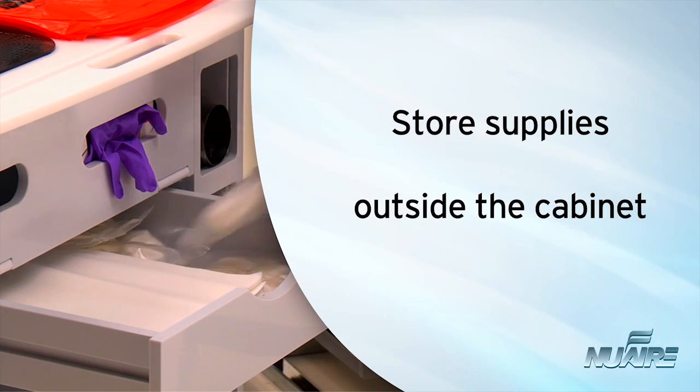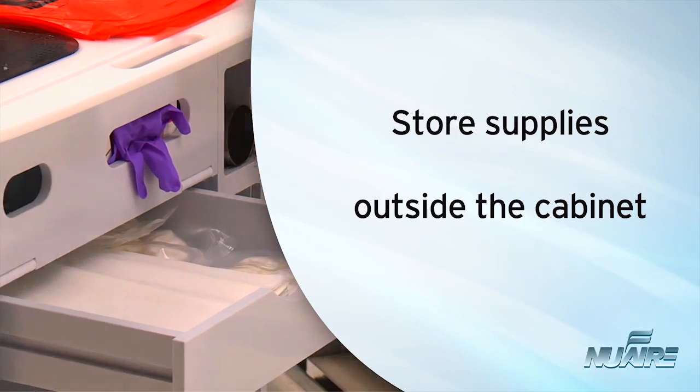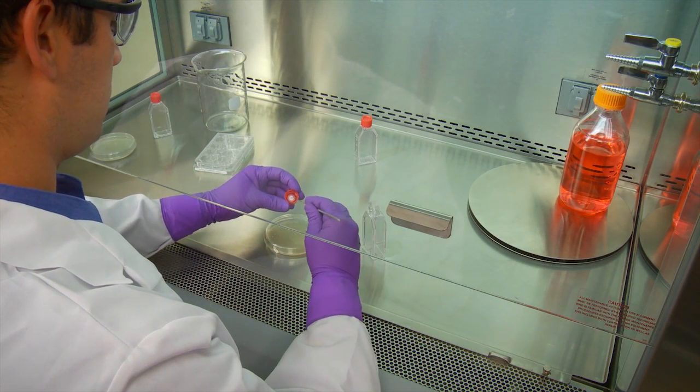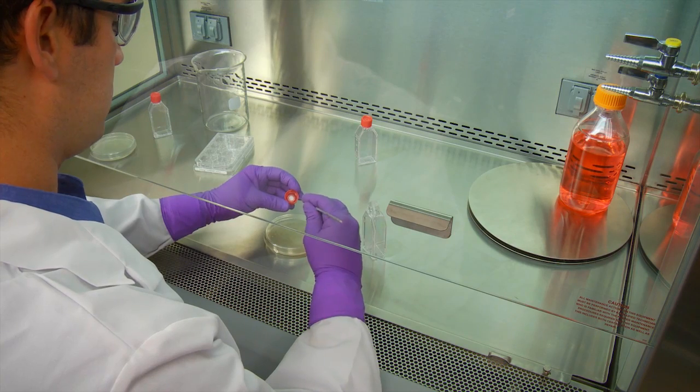Make sure extra supplies such as gloves, culture plates, or flasks are stored outside the cabinet. Only the materials and equipment required for the immediate work should be placed in the cabinet's work area.